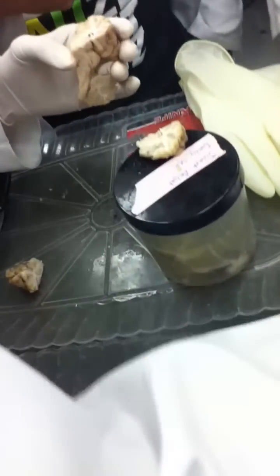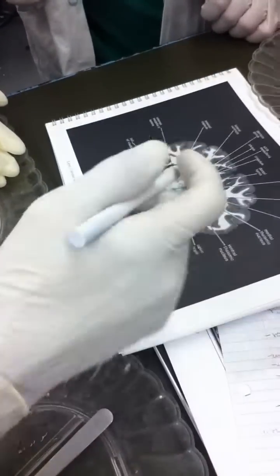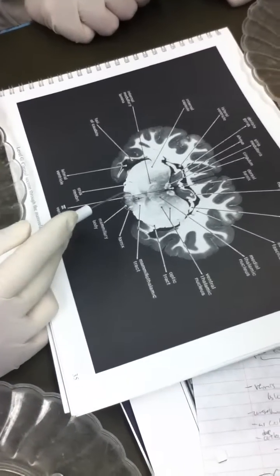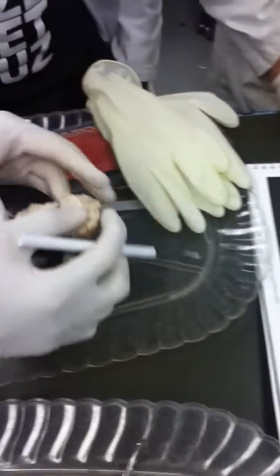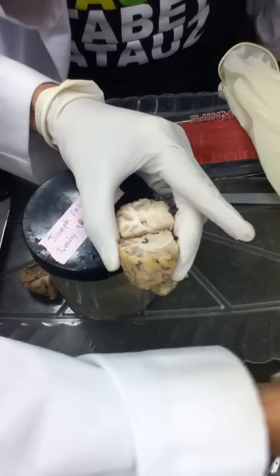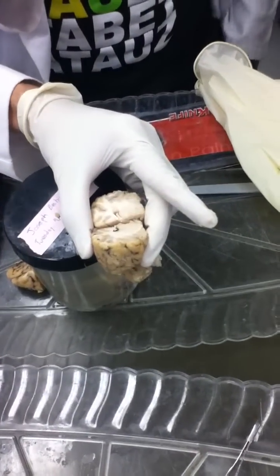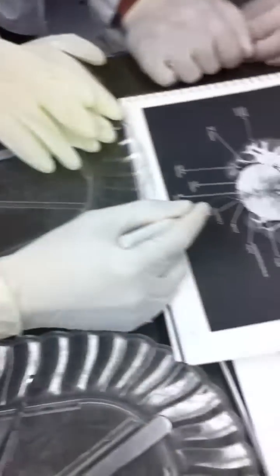But it should look like page 35 of your, this is 34, 35, sorry. You see 4 dots, like 1, 2, there should be 1, 2, 3, 4. So the bottom one right there, the bottom streak is not a dot. The dot has become a streak, as this guy here, and that's the fornix on its way to the mammillary bodies. Remember, the fornix goes from hippocampus to the mammillary body, and the mammillary body is right here, so it's just almost at its destination right here.